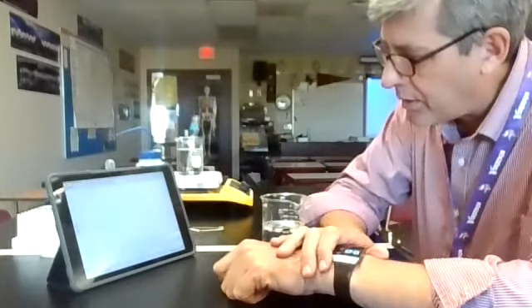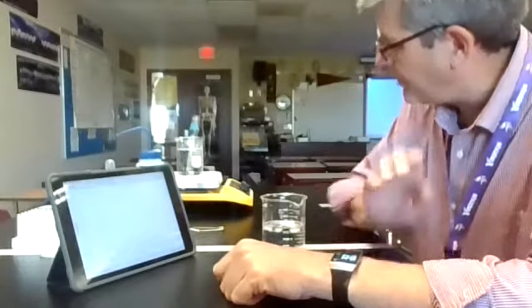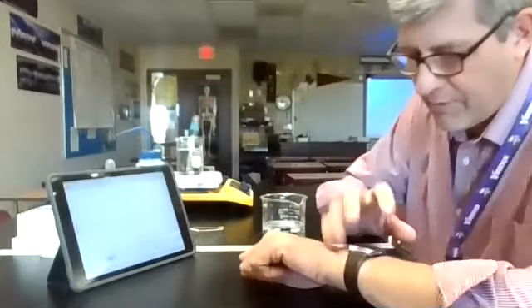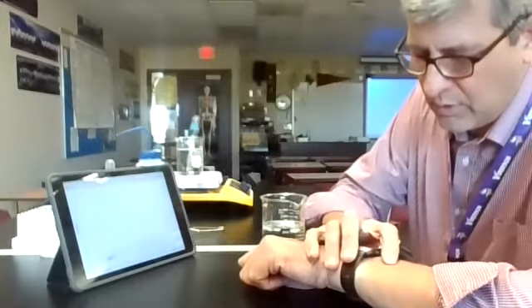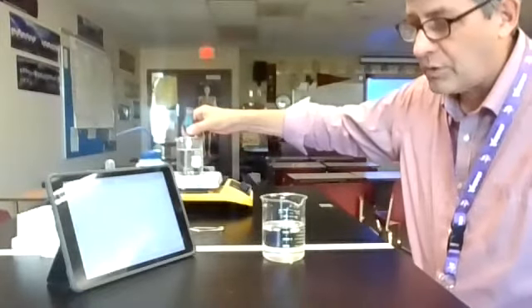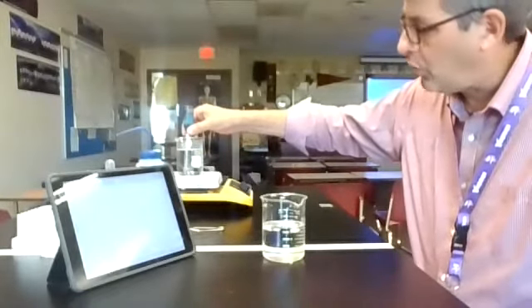Should be almost there. We're almost at 80 degrees Celsius, as you can see. And that was the goal, to get all the way up to 80. That should mean any impurities or anything, everything should be melted for us. We're very, very close to 80 now, and the time is up, so I'm going to pull this out. Now I'm going to switch this immediately to the cold water bath.